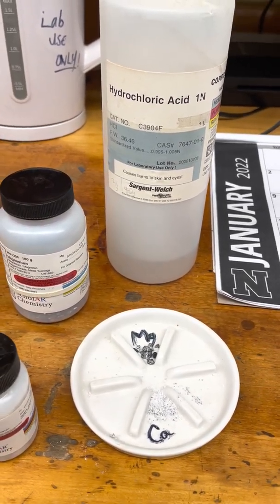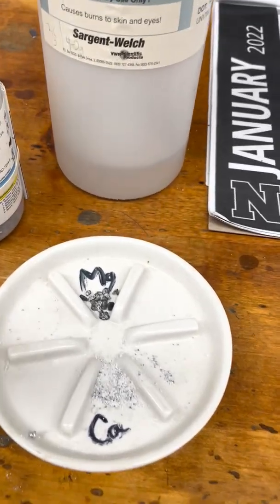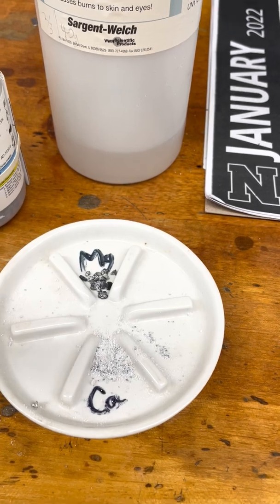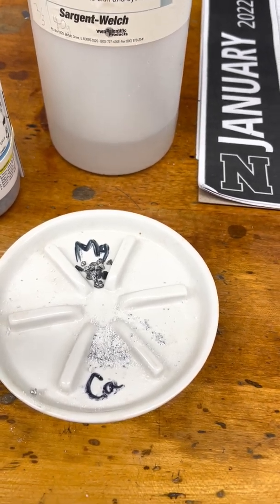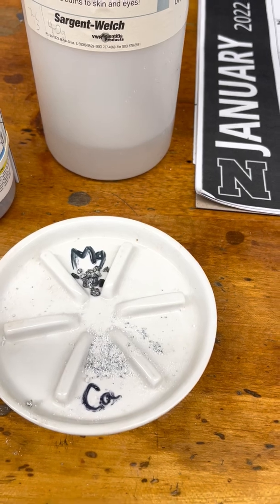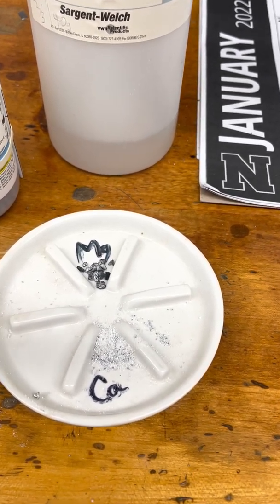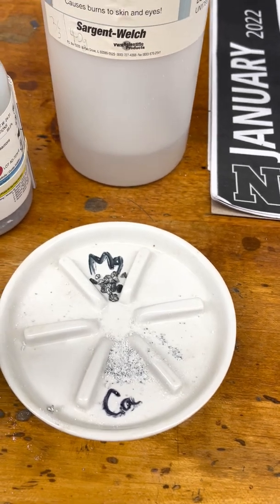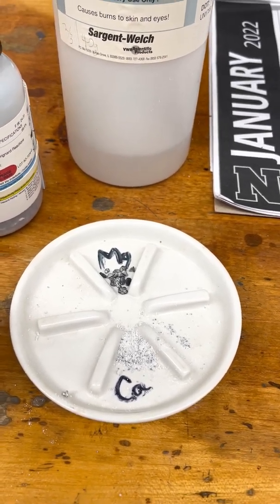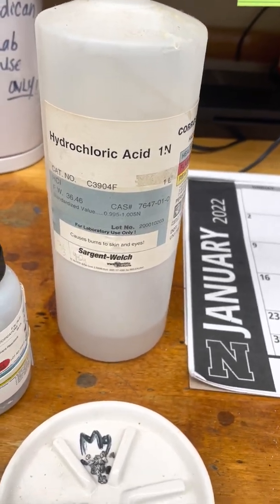Hi guys, it's Ms. Redican here. We're going to take a look at a little experiment. We're going to compare magnesium and calcium. Magnesium is a smaller atom in group two. Calcium is also in group two, but it's a little bit larger — it's below magnesium. They're both in the same group, and they both have the same valence electrons in the outer shell. We're going to see how they both react with hydrochloric acid, which is your stomach acid.